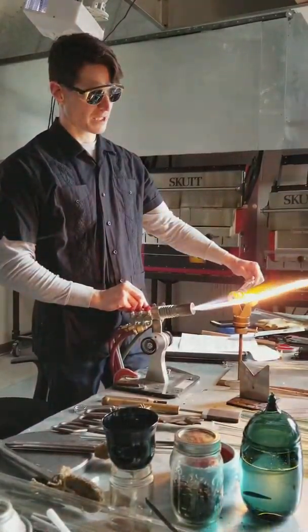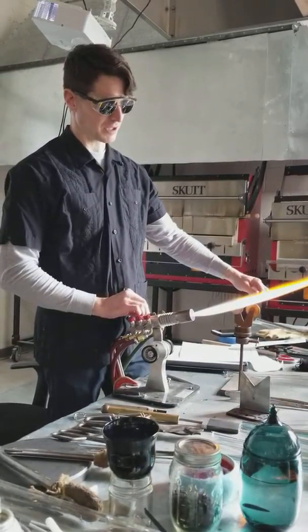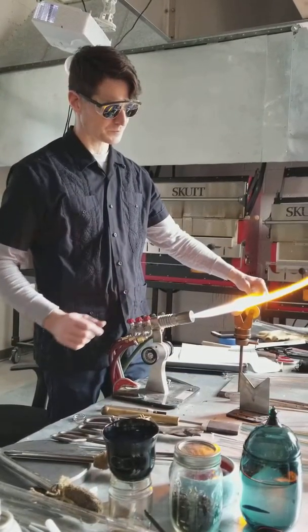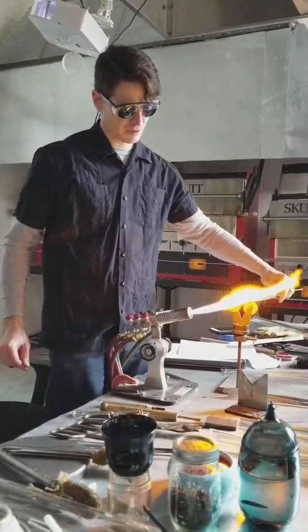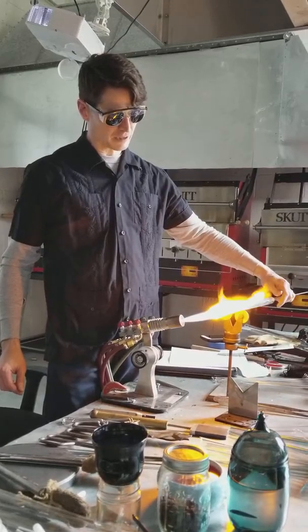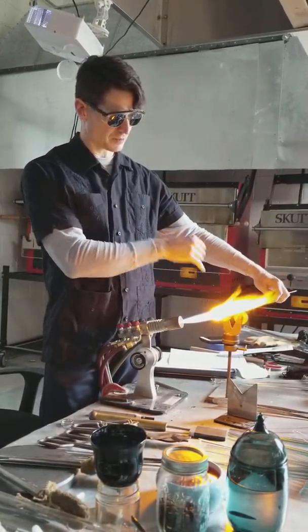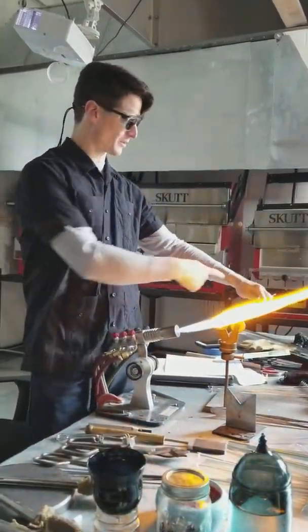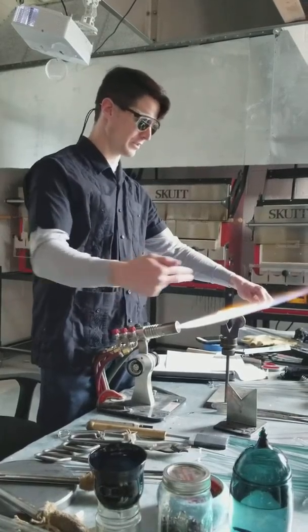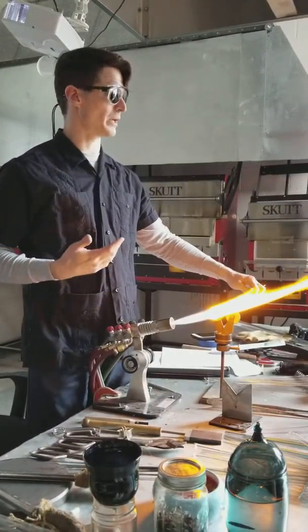Because of the way it is introduced, it's less consistent — it has more chance of heating unevenly. You'll get cracks if you try to go into a direct flame on this a lot more readily than heating down the middle of a tube. See how I kind of back out as I introduce the oxygen — I'm just touching the edge of my flame. The heat of the flame will go all the way down the tube and give you a nice wake up call.